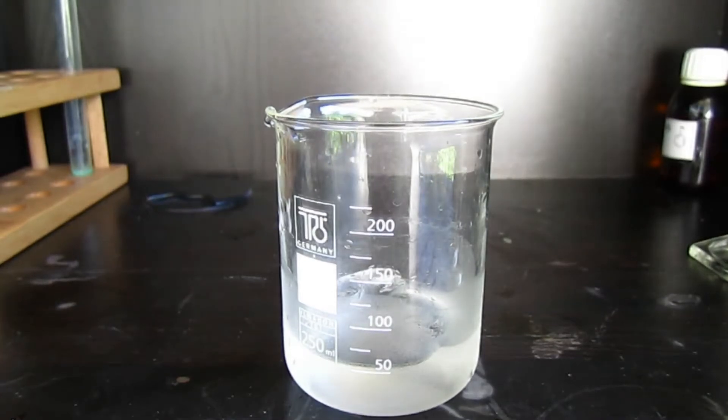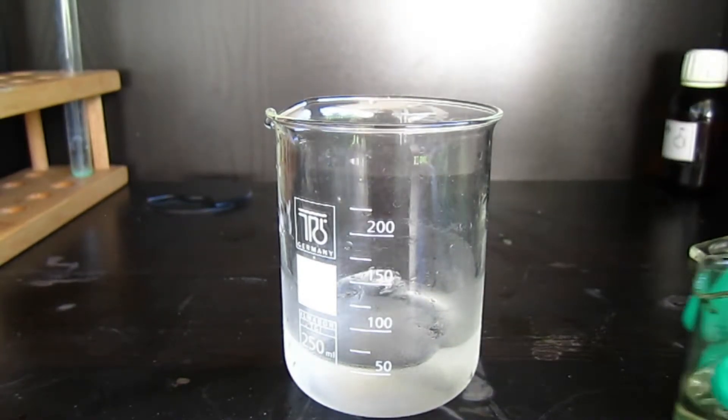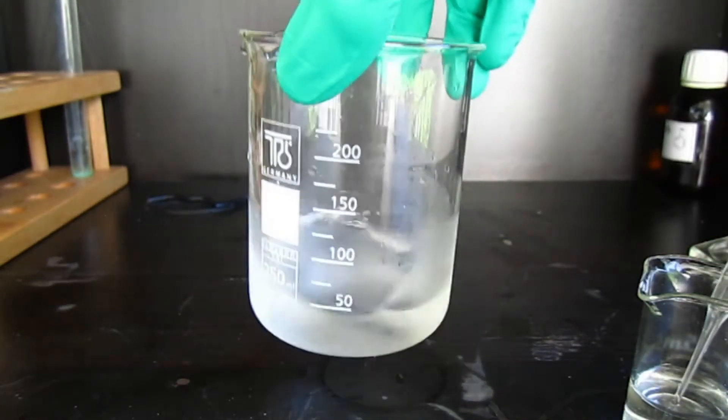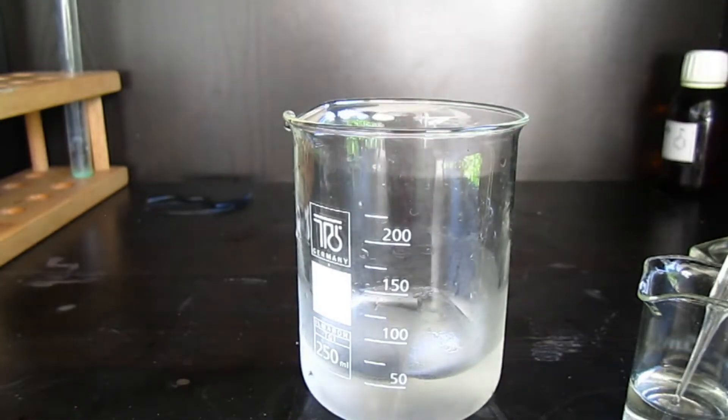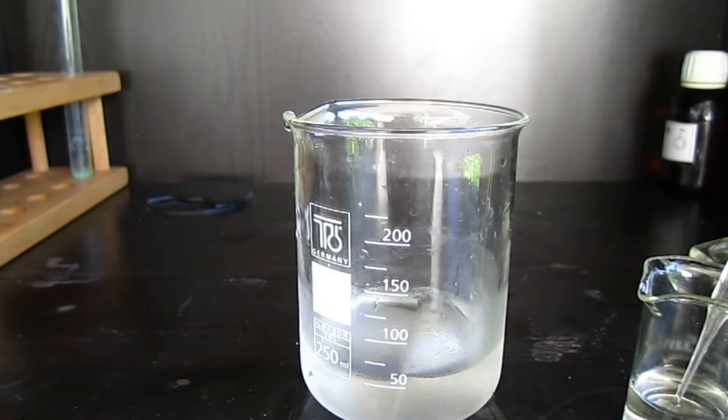So now I'm going to add the sodium nitrite solution to this aniline hydrochloride solution over a period of 15 minutes. This is like a standard diazobenzene procedure, so let's do it.